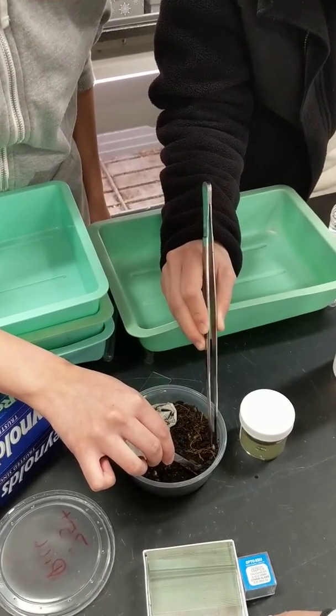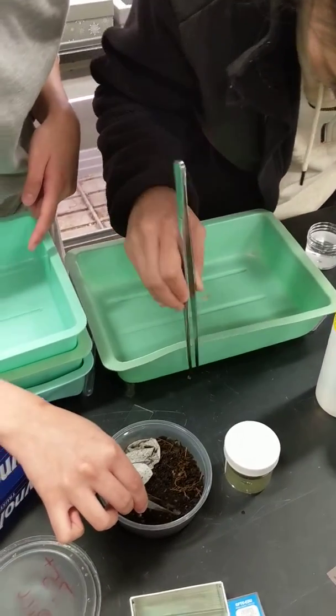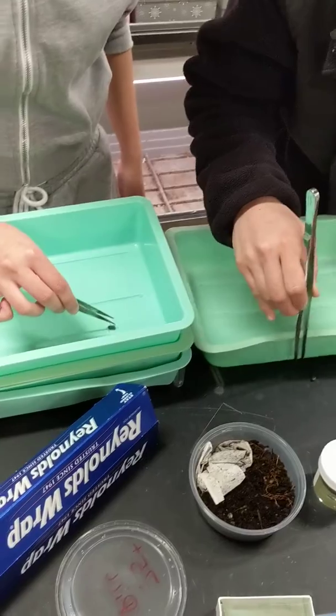Okay, so what are you guys trying to do? We're trying to put the isopods into the plate over here. About how many are you going to put in a plate? Ten. And then what are you going to do?